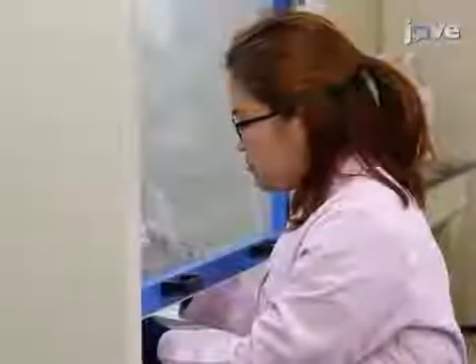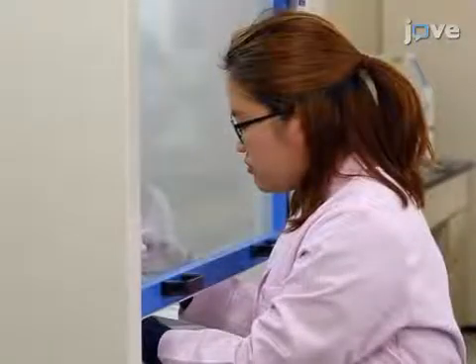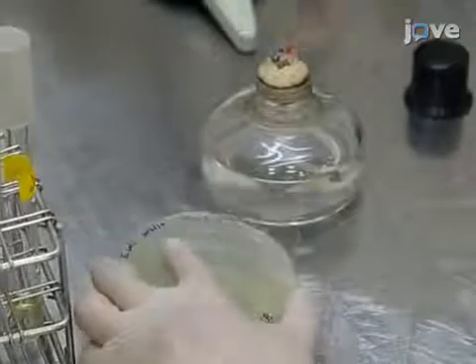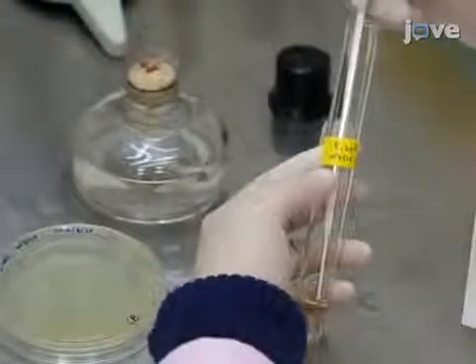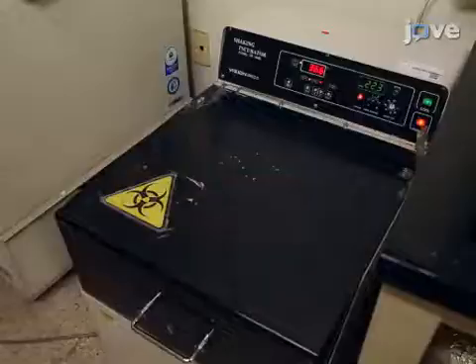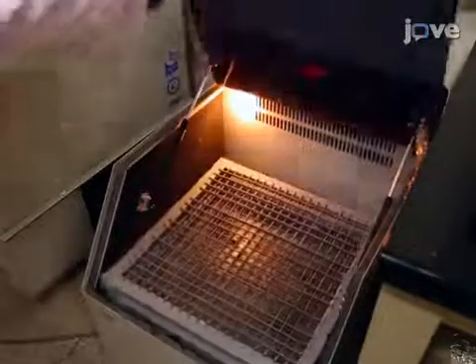Begin this procedure with the preparation of equipment as well as initial medium, stress medium, and high stress medium as described in the text protocol. Inoculate a single colony of wild type E. coli in a 15 milliliter test tube containing 4 milliliters of initial medium.